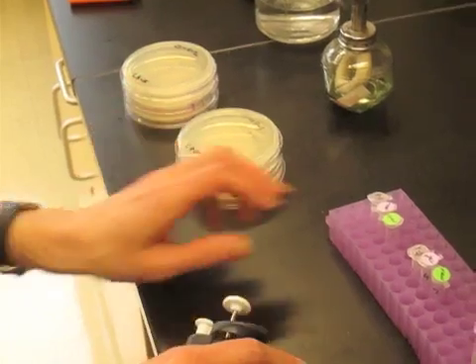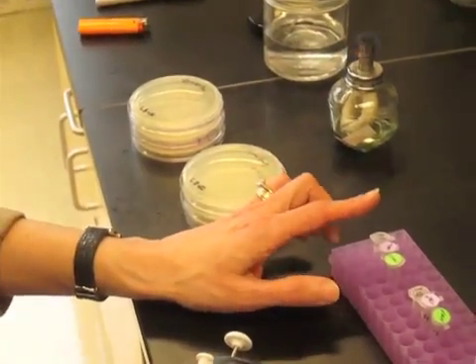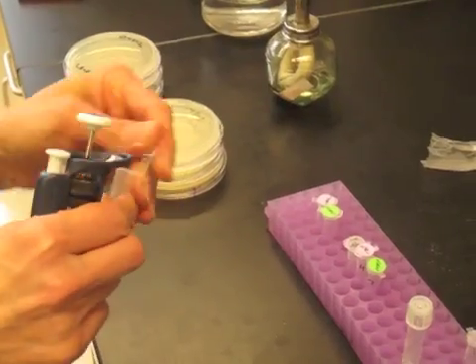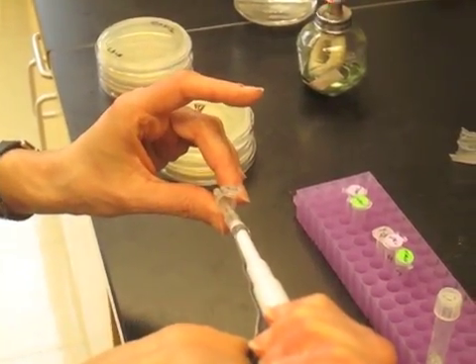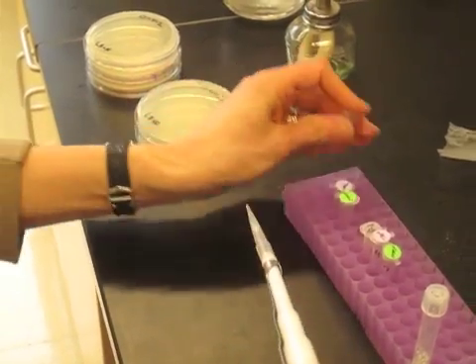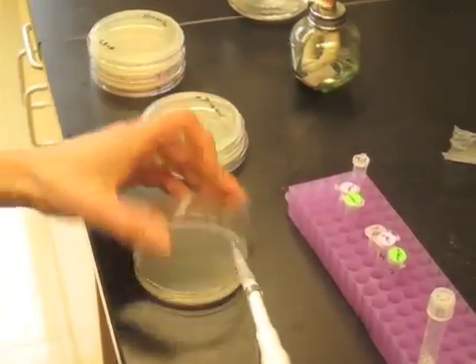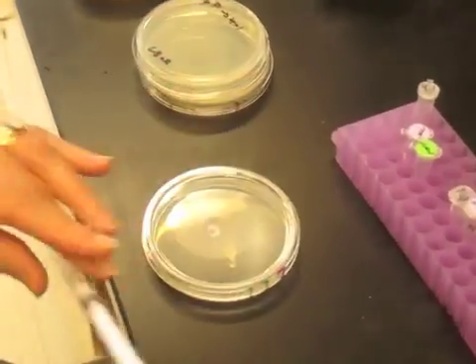But what I'd like to do is show that if you take 250 microliters out of the transformation mix and put it onto your petri dish, there are a couple of ways you could plate and spread the cells around.